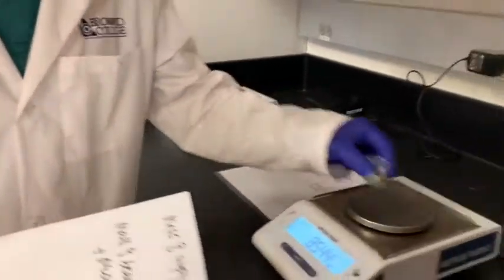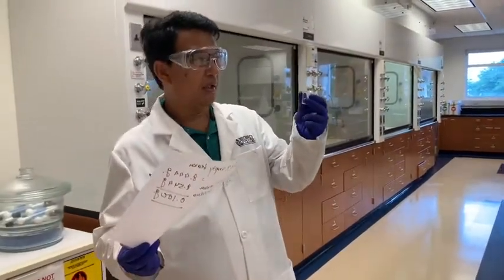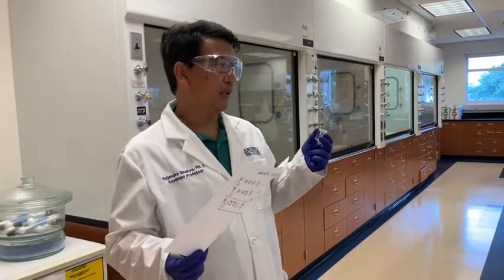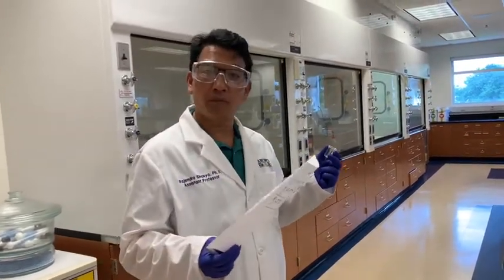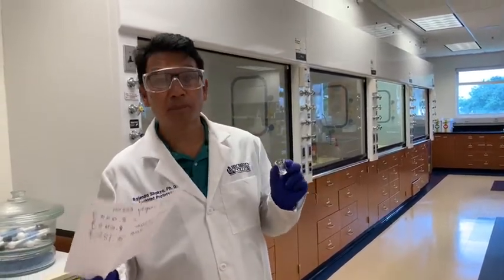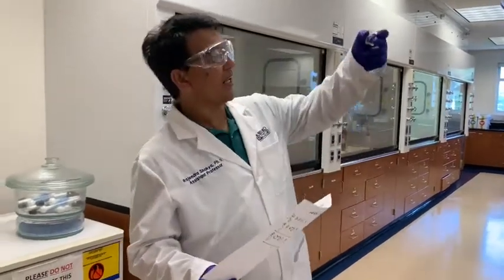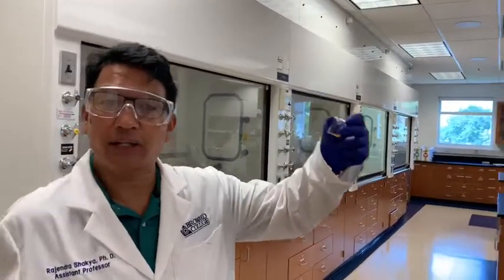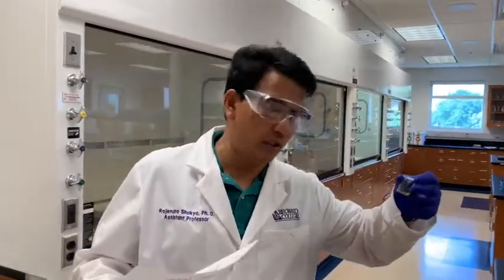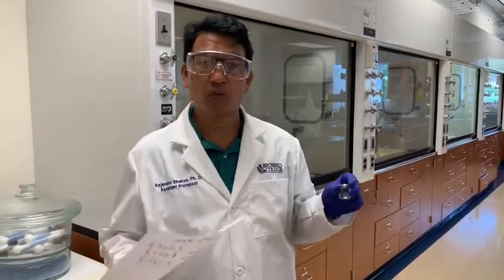Okay, so this is the crude product, and we could purify it by doing column chromatography quickly, using a very mini column in a Pasteur pipette. That is what your manual has suggested, but considering the amount of the product, we will not go to that part. We will take the IR and the NMR of this product, and we will characterize that. The product is very clean, and we have done the extraction, so there should not be too much impurity there. So this is a clean product.